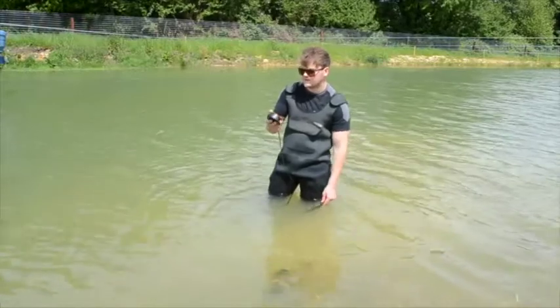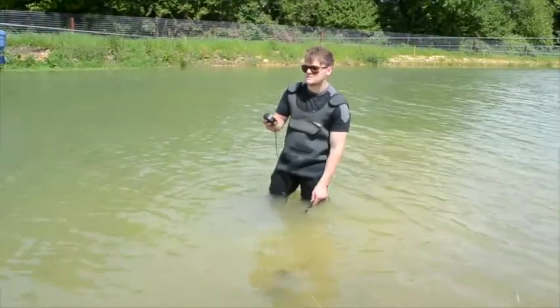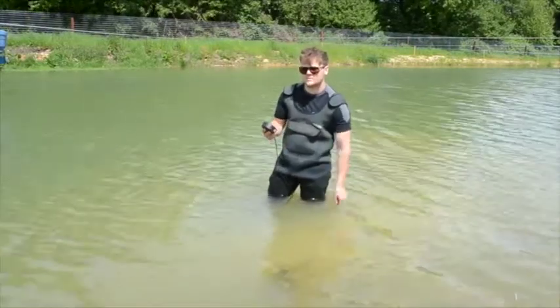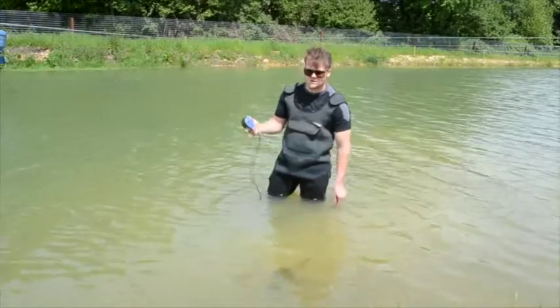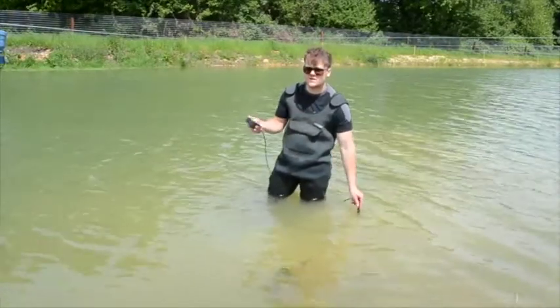At the moment we're reading 7.98 milligrams per litre of dissolved oxygen and 19 degrees. That's perfect temperature for feeding so we can put in around 3 to 5 percent body weight today - a really good feeding environment. Just one touch of a button and you're reading oxygen. Keep the probe moving, and don't touch inside the actual probe - leave the sensor well alone.